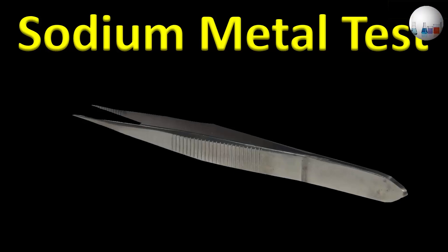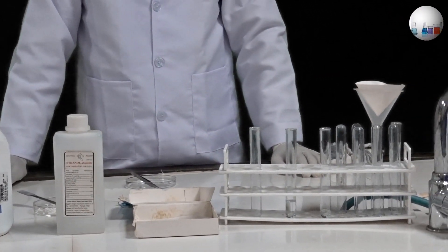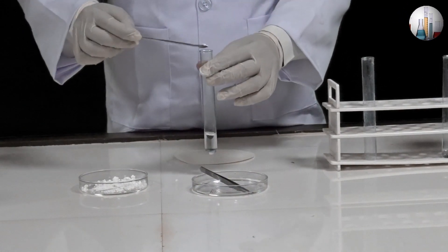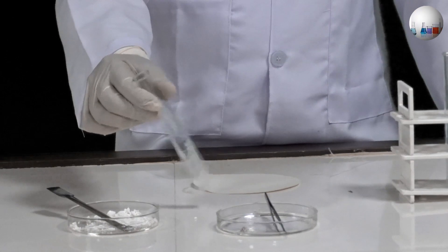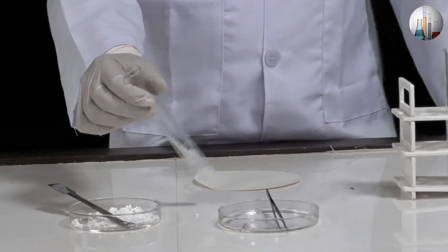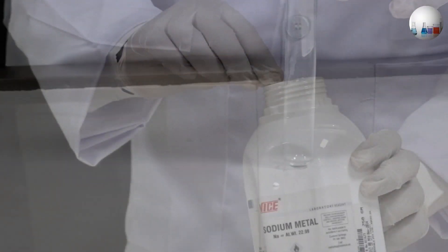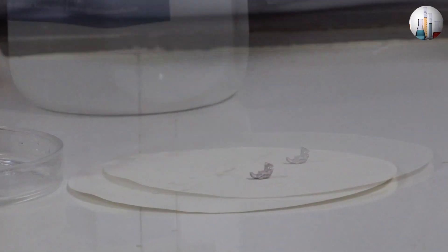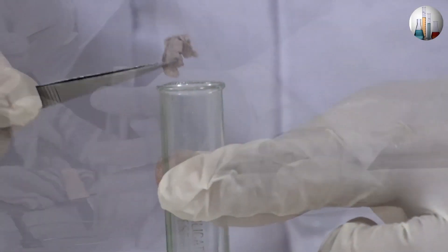We will now demonstrate the procedure. Take a small amount of the organic compound in a test tube. To this, add a small amount of anhydrous calcium sulphate using a spatula. Shake the test tube vigorously to enable the calcium sulphate to remove all traces of water from the organic compound. Filter the contents into another clean and dry test tube. Now take a small piece of sodium metal with the forceps, place it on a filter paper, and dry it with the folds of the filter paper. Put the dry piece of sodium metal into the organic compound using forceps.